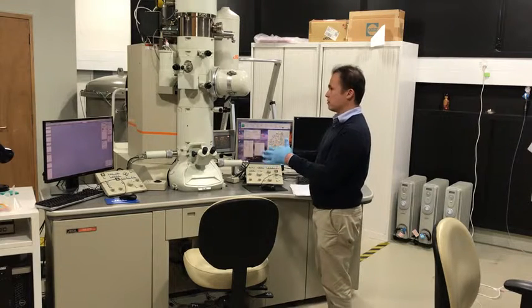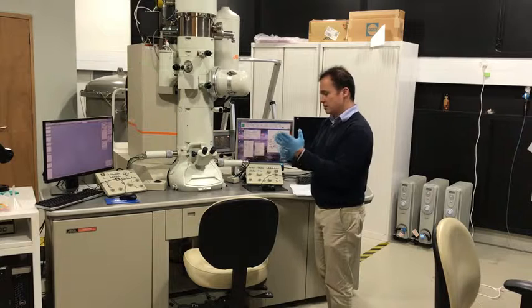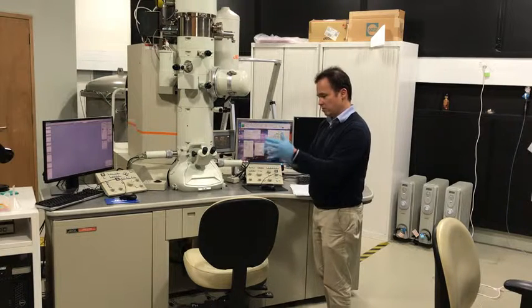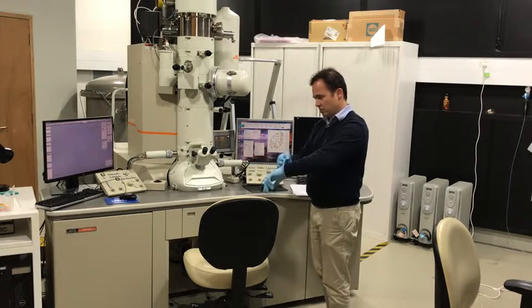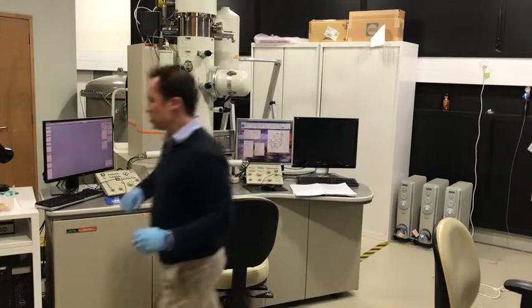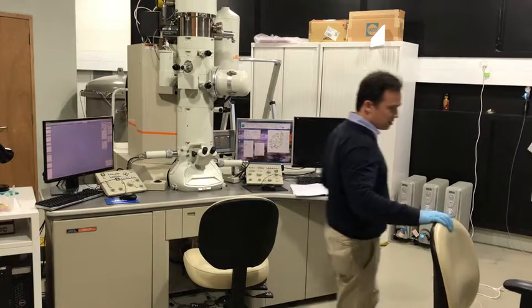Now I'm about to remove the specimen holder. So if there's an inlet of gas, I don't want to ruin the vacuum gauges. So I'm going to go into the little hutch here and switch the gauge readout down an order of magnitude in sensitivity.